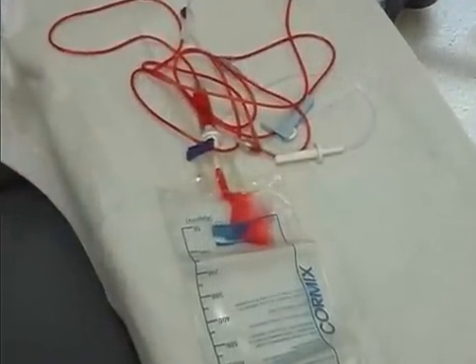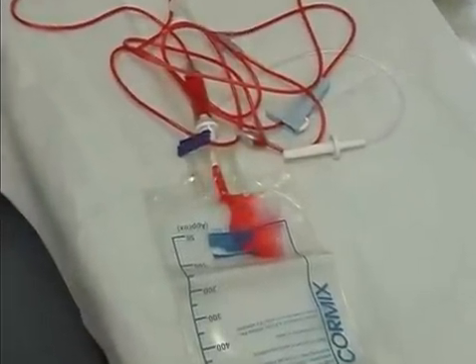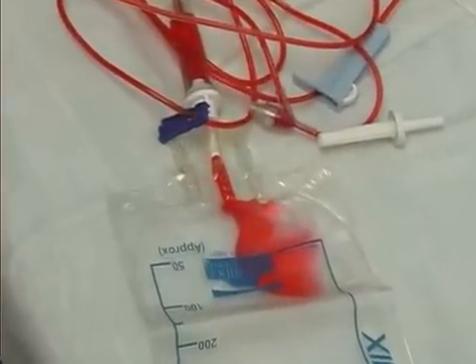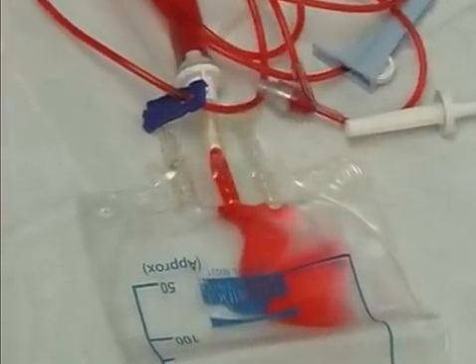The final bag should be labeled with the nurse's name and date of the test and be incubated in the same manner as the original test materials.